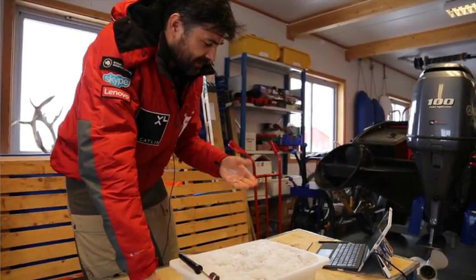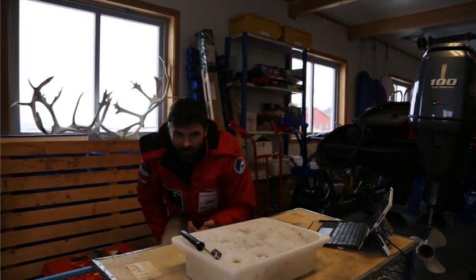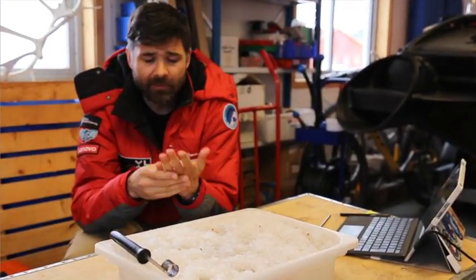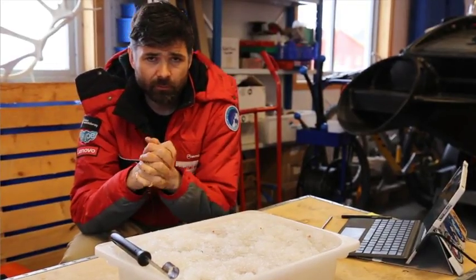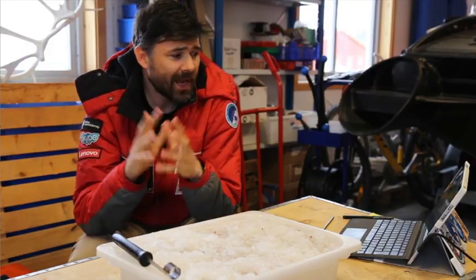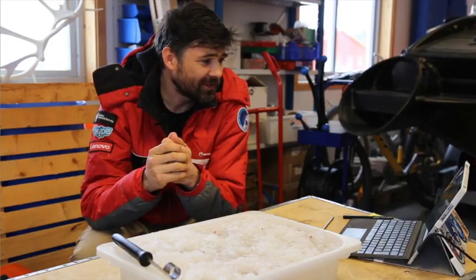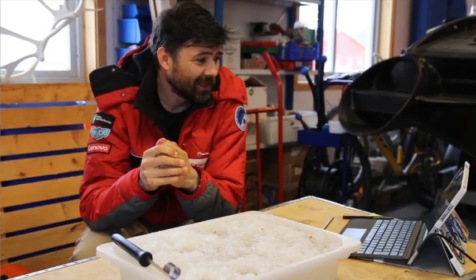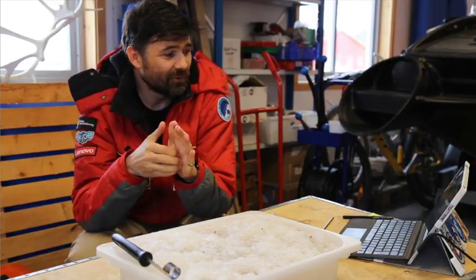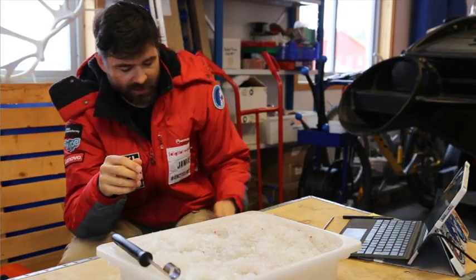I'm going to sit down and try and warm up my hand, because handling Arctic snow is not always that comfortable. So we take an average of our samples, of course, brilliant maths students across the world who are going to be telling me 8.5. Fantastic for all of you who had 8.5. Fantastic to those students in Miss Ferrer's, Woolston's and Woods classes. Really, really good. Tim says 8.5. Tim is spot on.